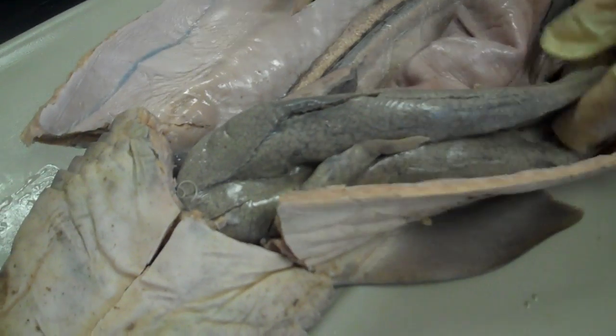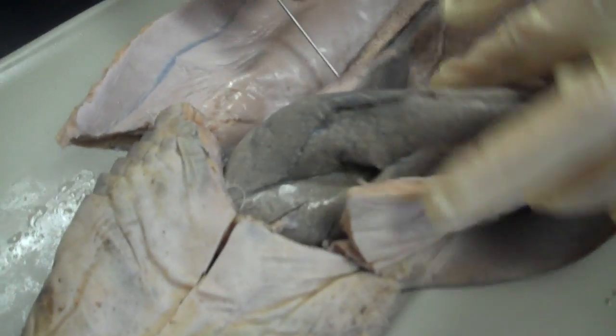Where's the gallbladder again? The gallbladder is in the center here. Now the testes is where the sperm is made.